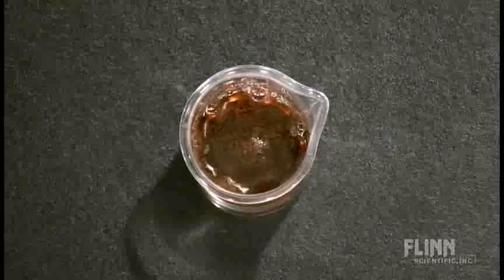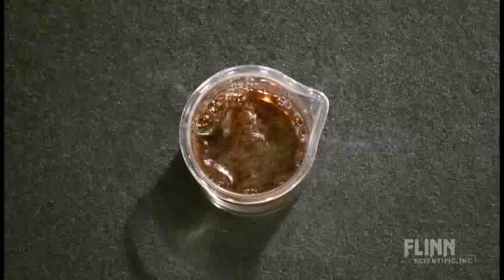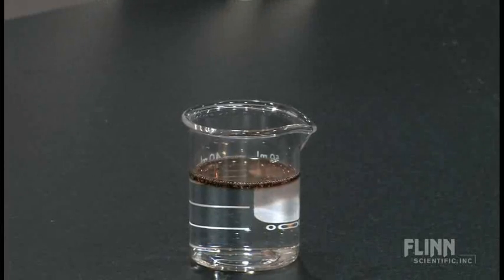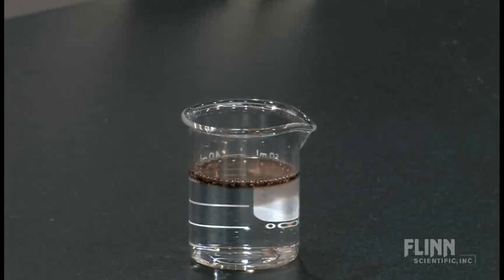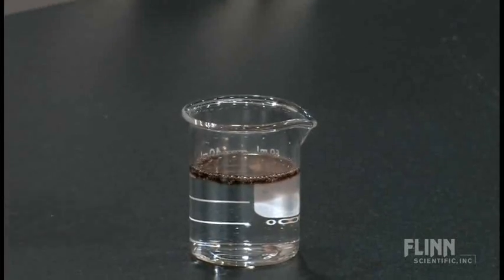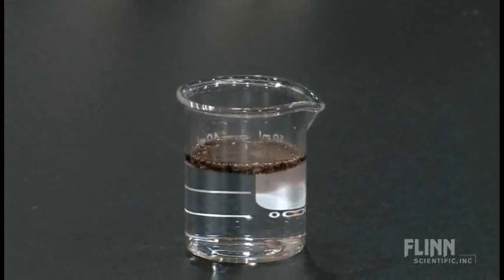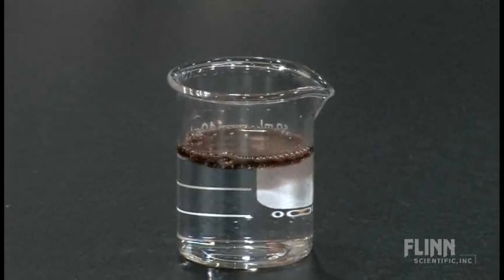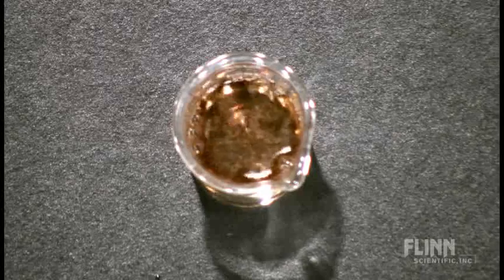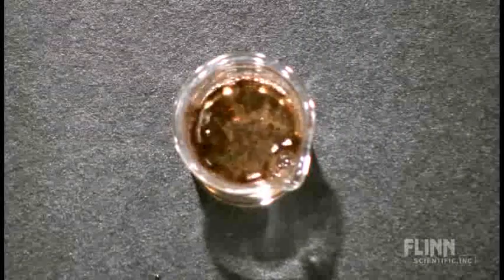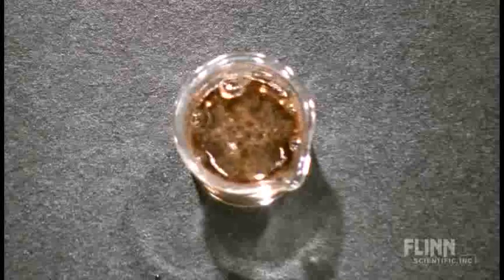You notice an immediate change. The orange color of the iron nitrate becomes black because it is catalyzing and forming an intermediate to the reaction. You notice that we immediately, or almost immediately, begin to see the decomposition of the peroxide. The peroxide is evolving oxygen gas.